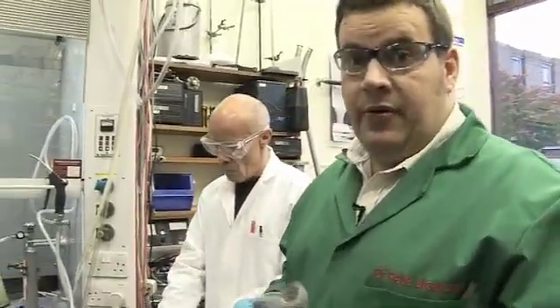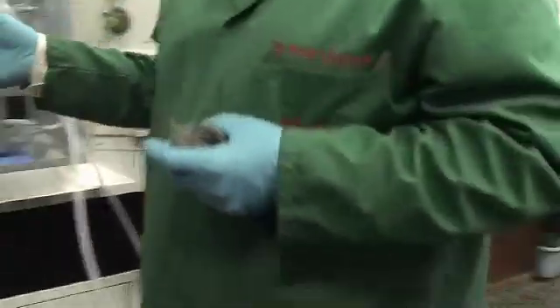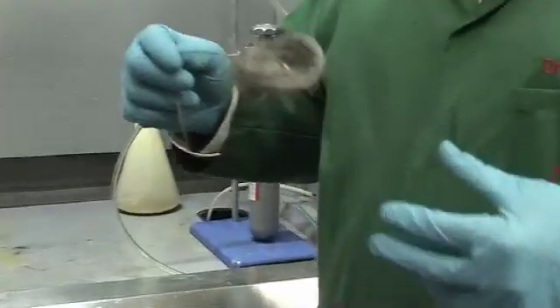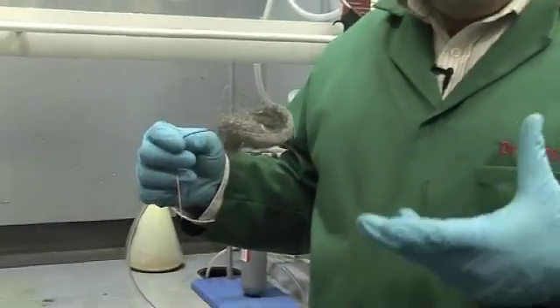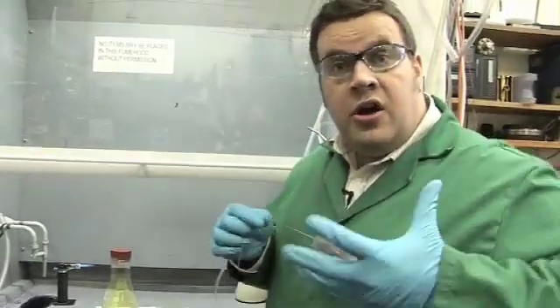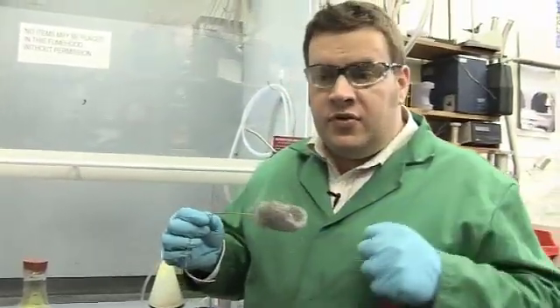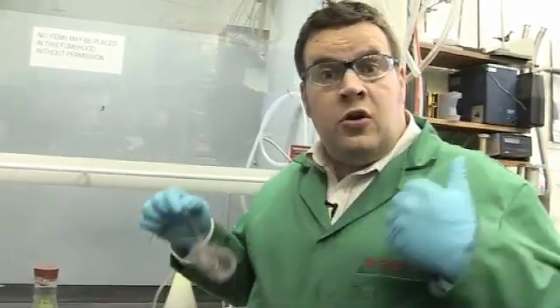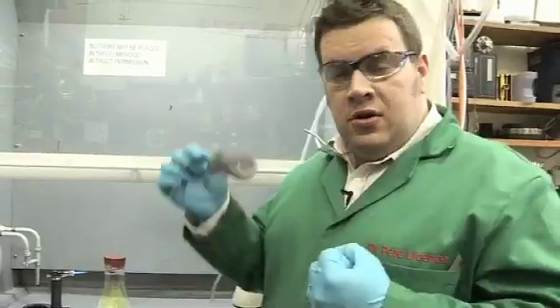While we've got chlorine here, we thought we'd do a couple of reactions. So we've got some chlorine in this flask and you can see the nice yellow colour. And I thought what we'd try and do now is do a competition reaction again or a reaction with iron. So now the iron, we're going to heat the iron. This is iron wool which you might use for treating wood. And we're going to heat that till it's warm and put it in the chlorine. The chlorine will oxidise it to iron chloride.